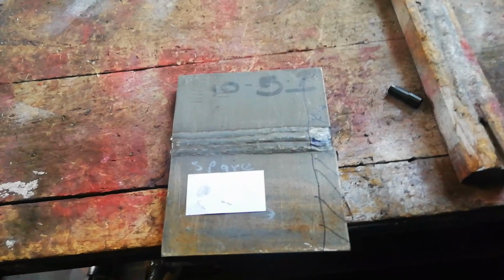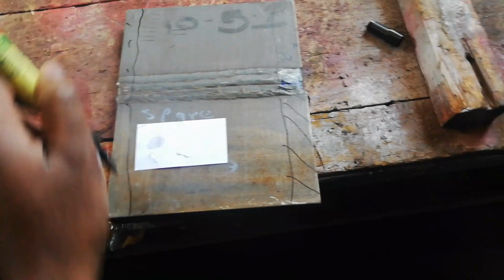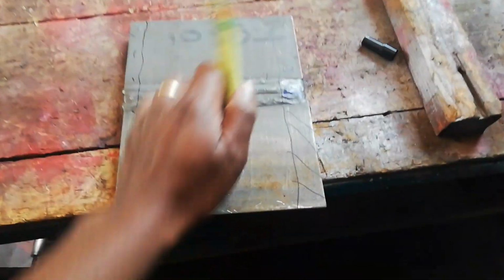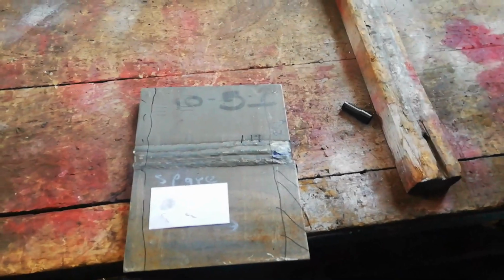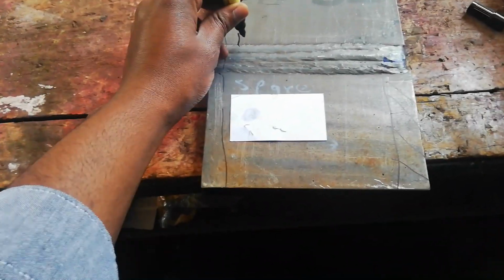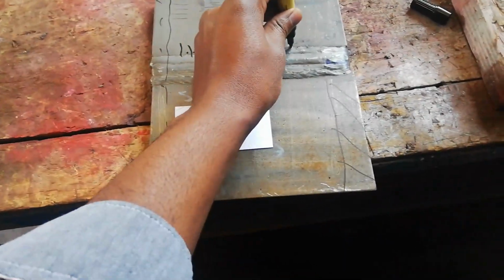After discarding that part, we're going to have to discard this other part as well. That needs to be more or less 25 millimeter. Once that is done, we're going to cut our first tensile there. After cutting our first tensile, we're going to cut 2 bends. Let's say that we are dealing with ISO, so 2 bends there. Here again we come for our second tensile and 2 bends. We're going to have 4 bends and 2 tensiles.